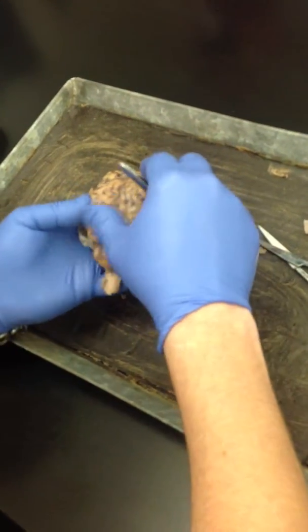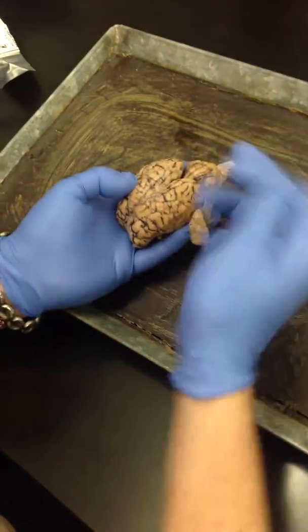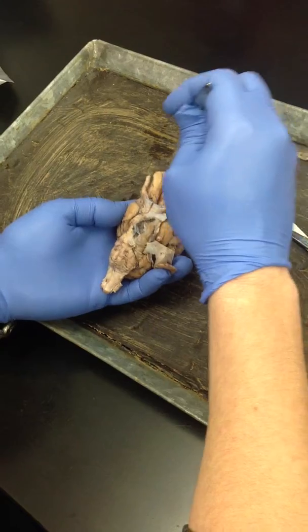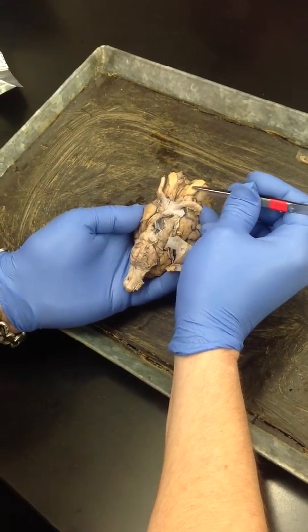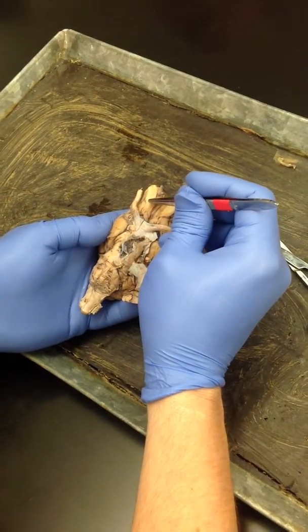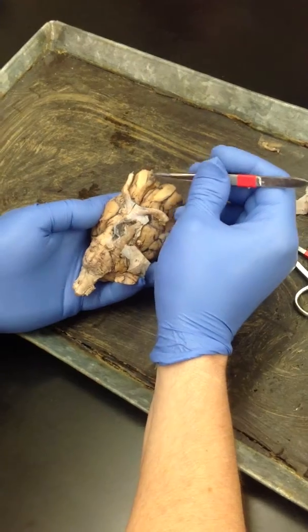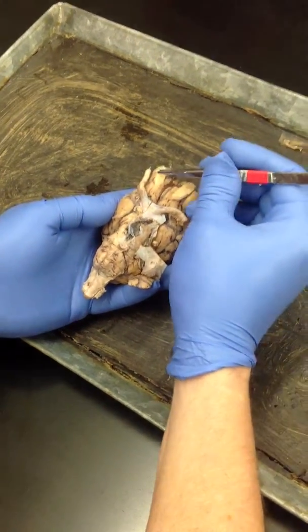Okay. So we've got the cerebellum here on the back, and then I'm going to flip it so we look at the underside. So frontal lobe is right here, and you can see really pretty olfactory tract, and then the olfactory bulbs, these guys. So the tract comes like this, and then these are the bulbs. And you can see they're nice and big. Sheep have pretty good smell. So those are the olfactory bulbs.